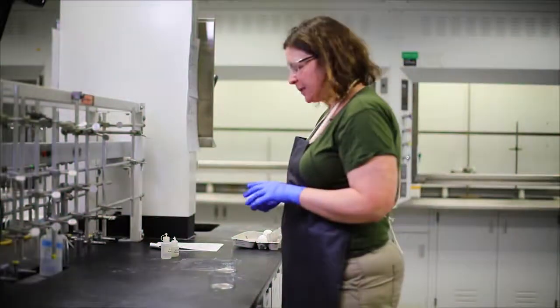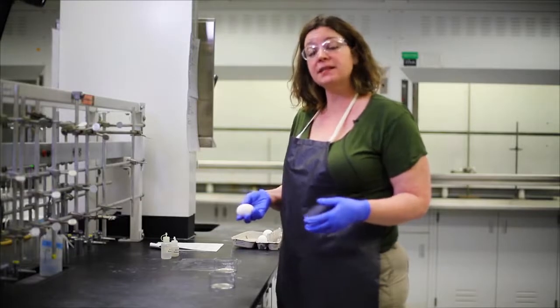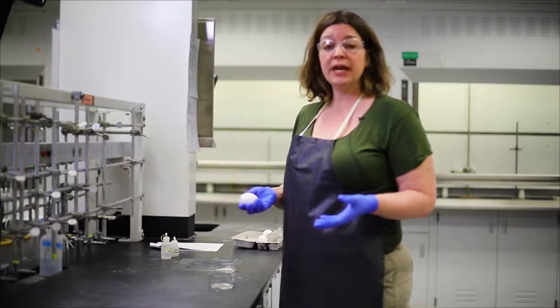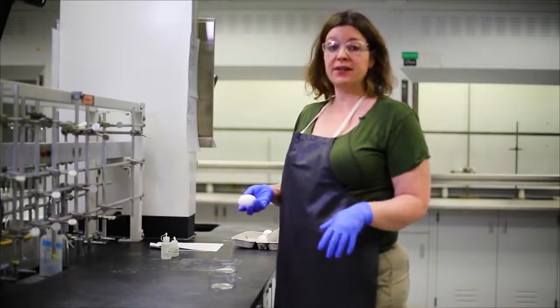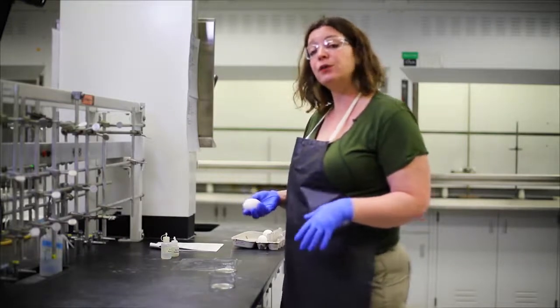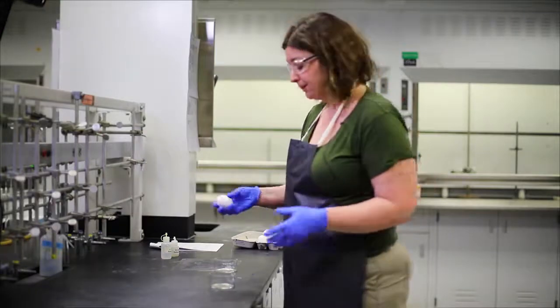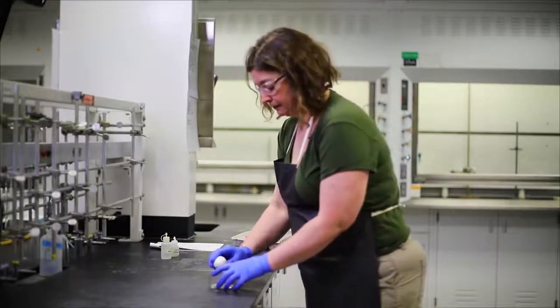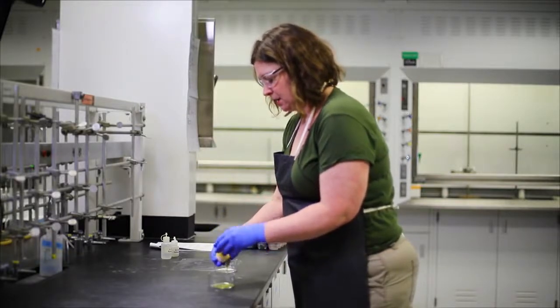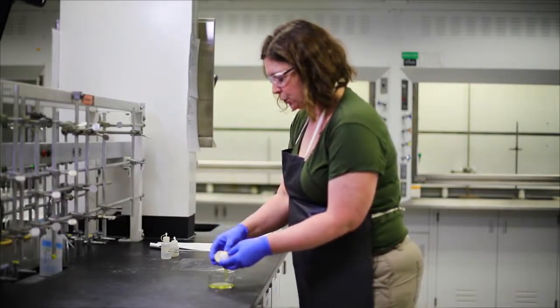Okay. In this demonstration, we're going to show you the effect of both acids and bases on proteins. So essentially, we want to really demonstrate why we tell you you have to wear safety glasses or goggles when you're in lab. We're going to show you what would happen if you got corrosive material in your eye and why that would be such a bad thing. So I'm going to take an egg, and ideally, I'm going to be able to just get the egg white because this is most similar in chemical content to your eye.